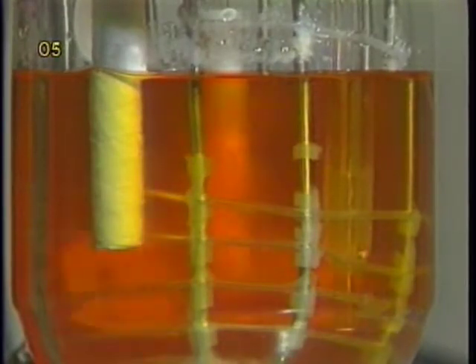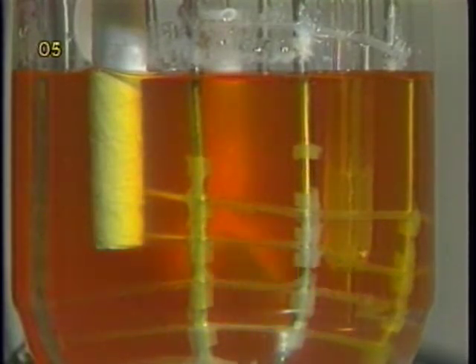A minimum agitation required to keep microcarriers completely in suspension should be used at the beginning of the culture. The impeller speed shown for this confluent culture is somewhat higher than that which should be used for a culture in its initial growth period.